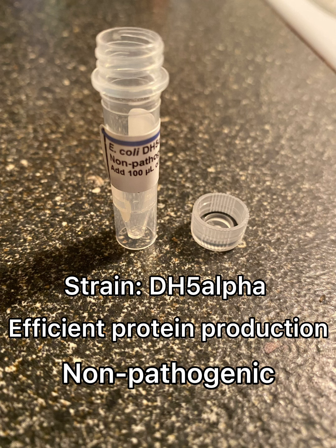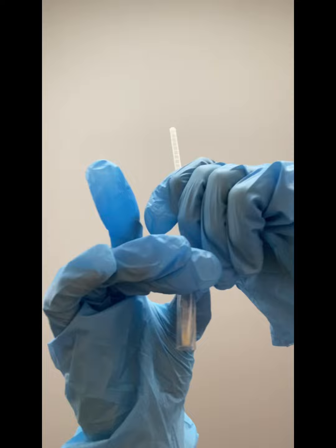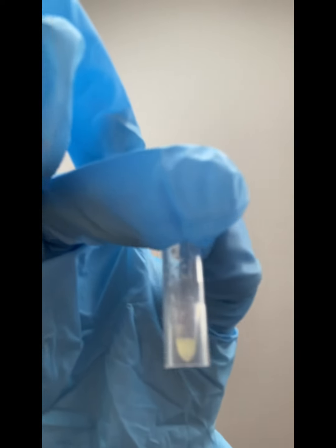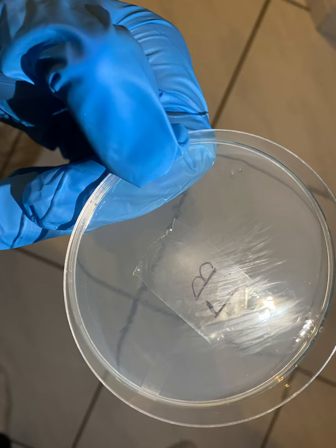Now that you have your plates made, you'll need to prepare the E. coli. To do this, take it out of the freezer and add roughly 4 drops of sterile water. Next, you'll need to mix up the E. coli, and you can do this one of 2 ways. You can either use a sterile inoculation loop to stir up the E. coli, or you can use a pipette to suck up the E. coli and drop it back into the tube.